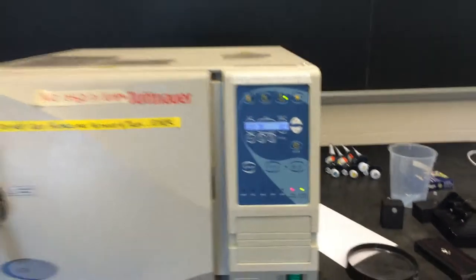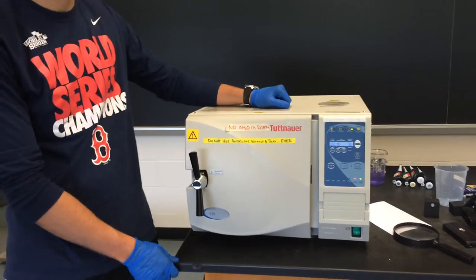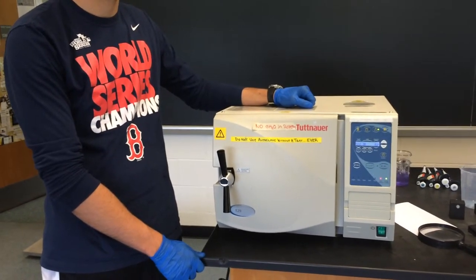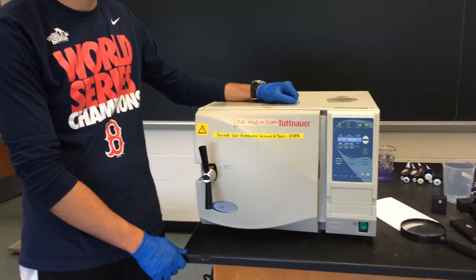After you're done also, you want to clean the tray if there's any liquids that fell out of your container.